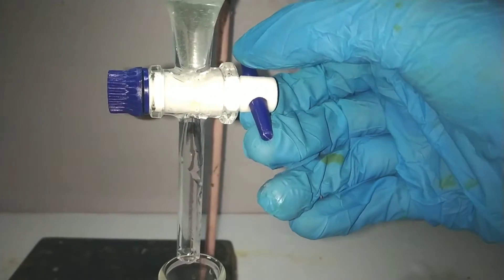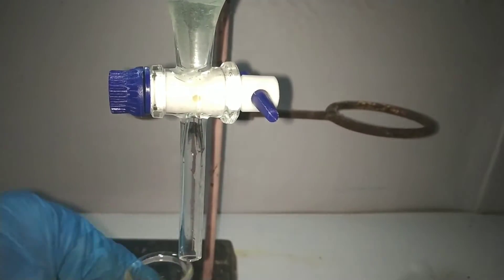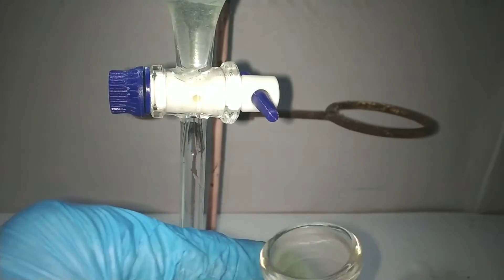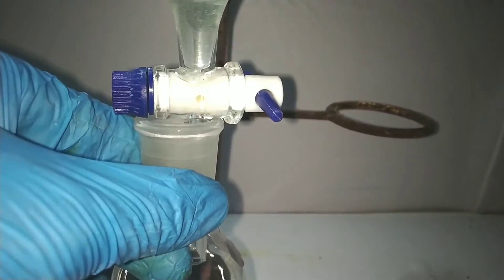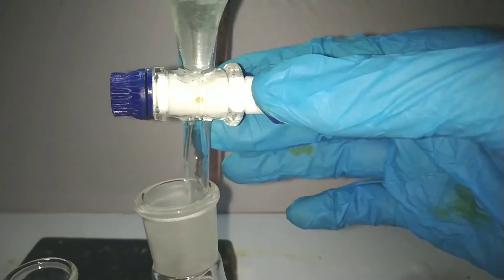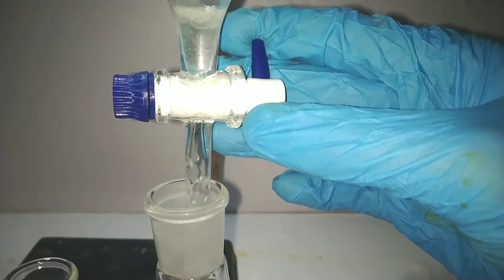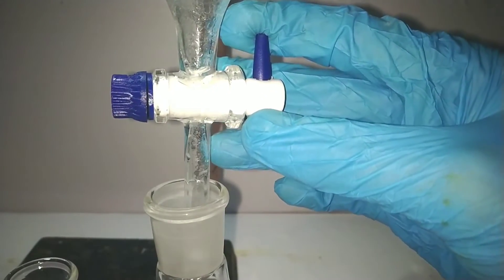Ideally solvent extraction should be performed with DCM, but when I thought of distilling DCM and then later distilling aniline, I decided to skip that part. But for my purpose, this purity was good enough.